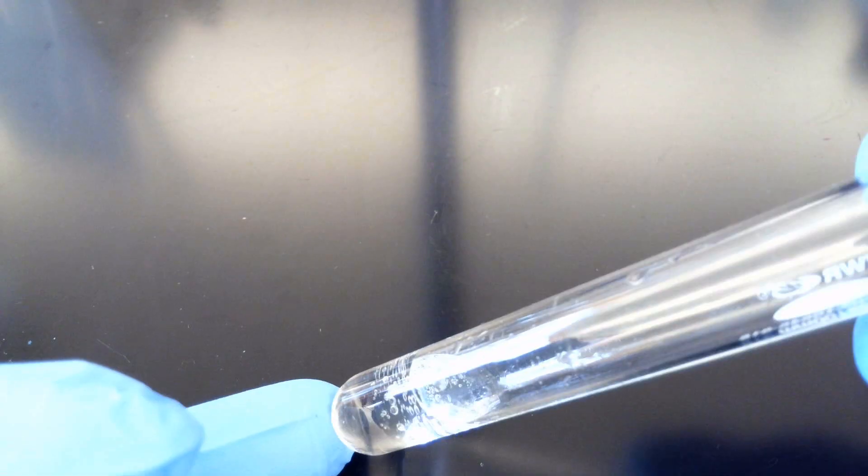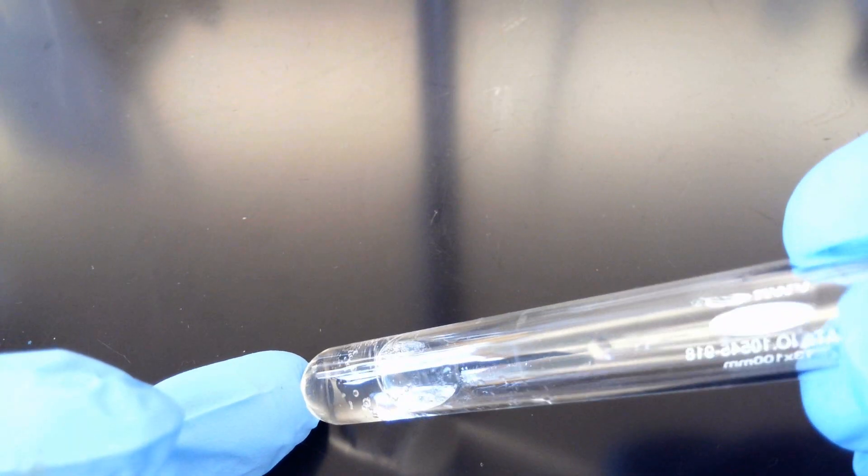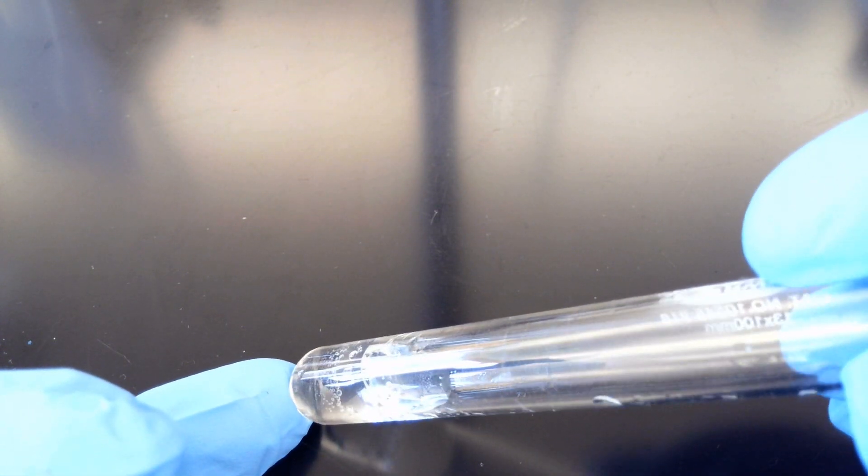And our last test, we added HCl. Here is our unknown with HCl. Lots and lots of wonderful bubbles.